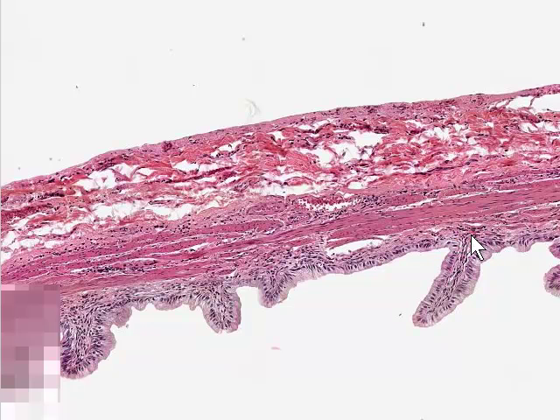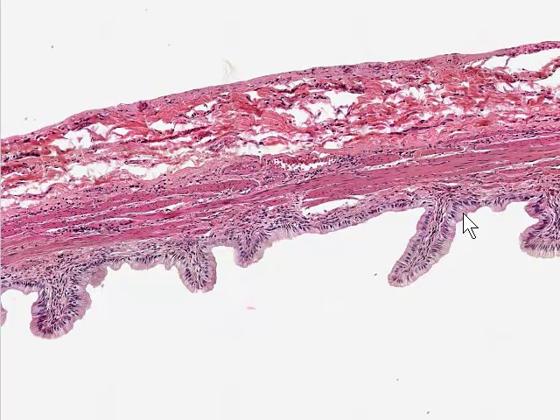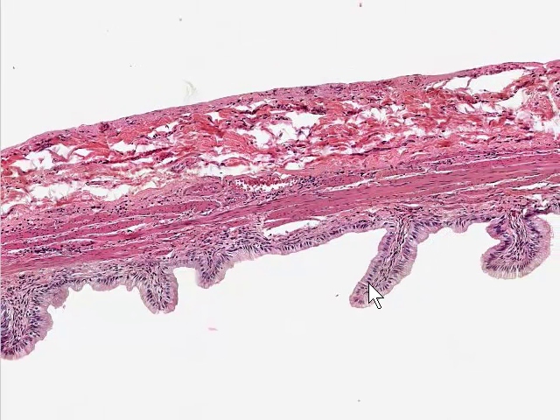The surface is elaborated as a series of structures that look like these, almost like villi. I suppose perhaps it's questionable whether they really are villi, but it isn't really that important. Even at this magnification, you might be able to see that the epithelium is a simple columnar epithelium. These folds have a little core of lamina propria here. We can see some connective tissue in this region here, and then what looks like some smooth muscle here, some strips of smooth muscle interspersed with some connective tissue, and indeed this is the structure of the wall of the gallbladder.